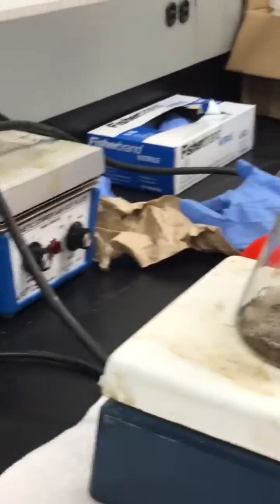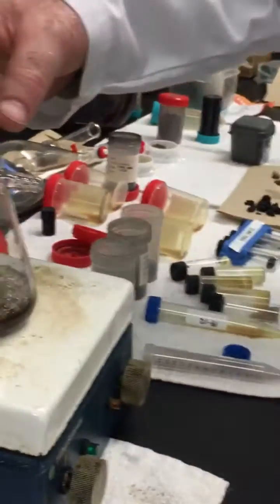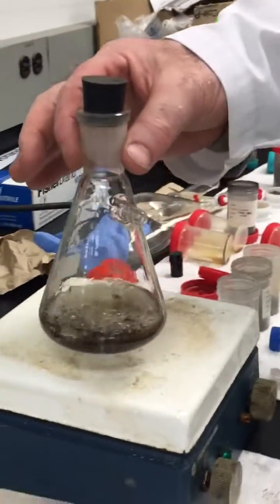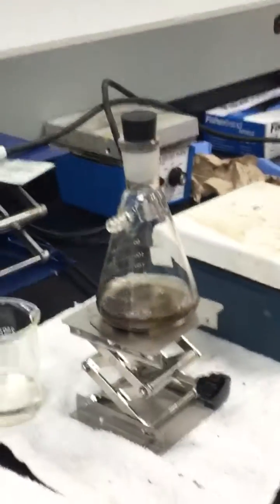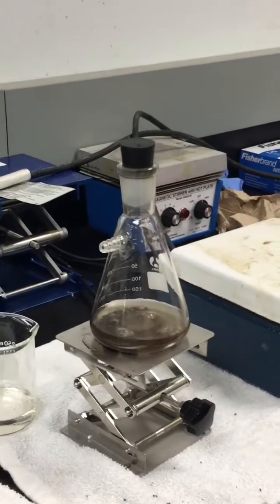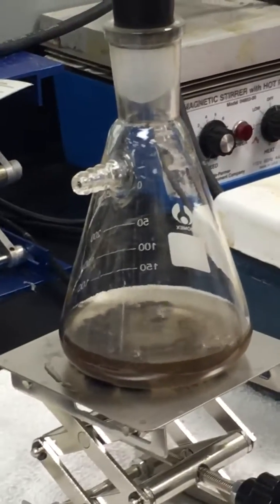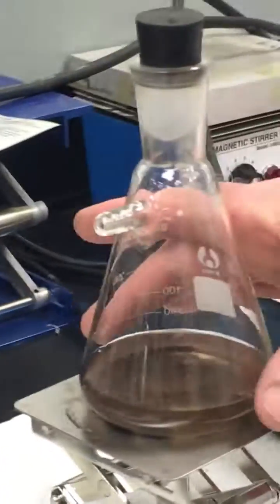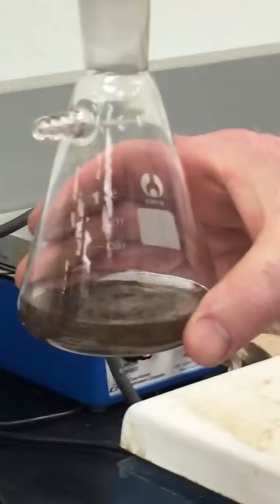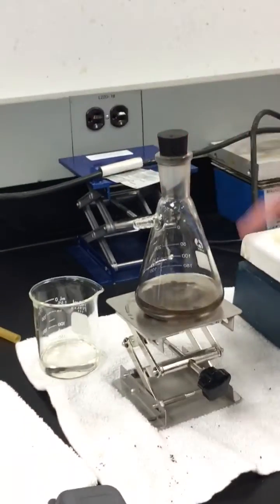We'll now remove the liquid catalyst from the hot plate — just showing the paper moving — to demonstrate that over time the velocity of the gas being removed will reduce. Without wearing protective gloves, it's still cold to the touch. We've almost stopped the gas being removed, just some small trace amounts.